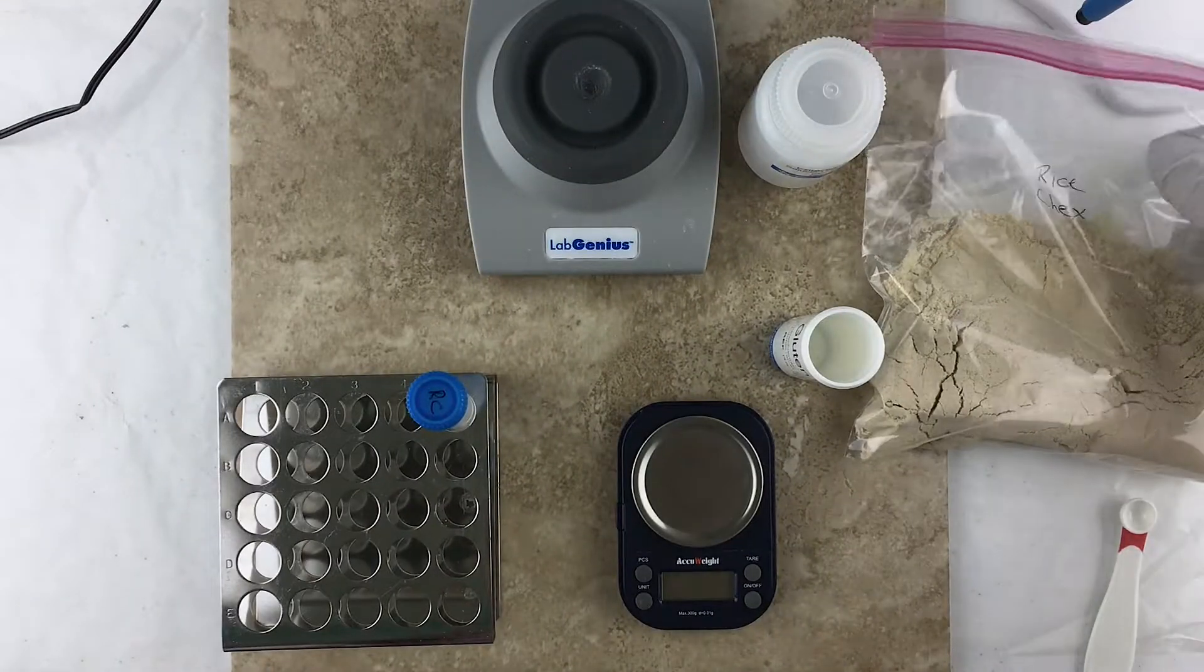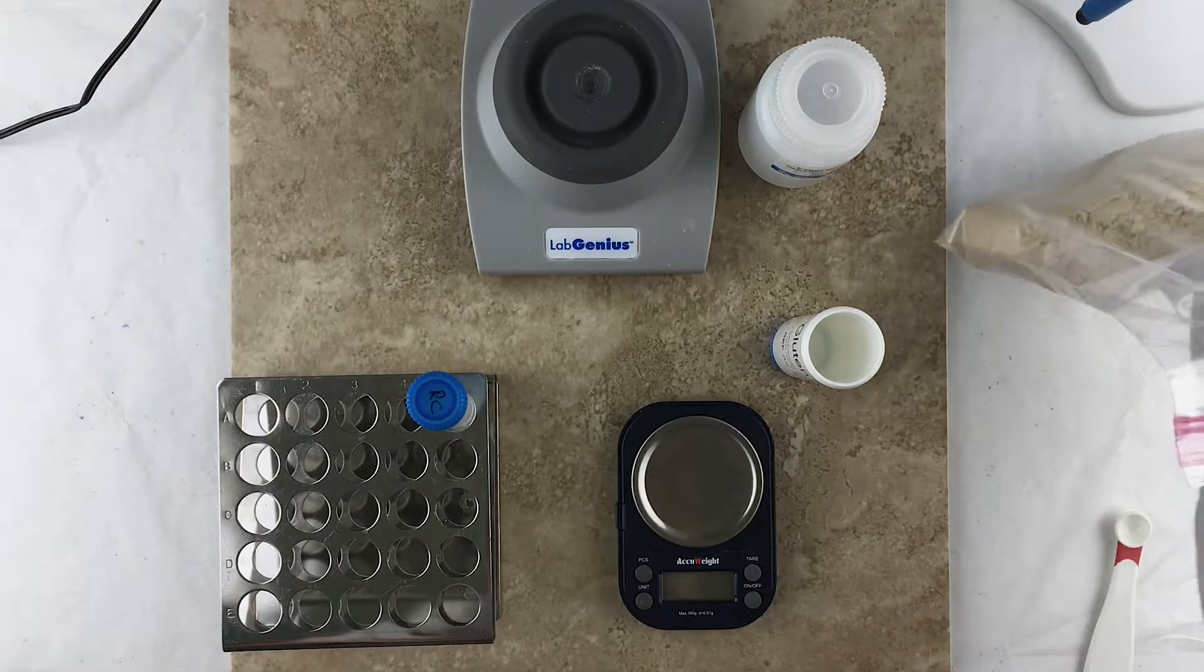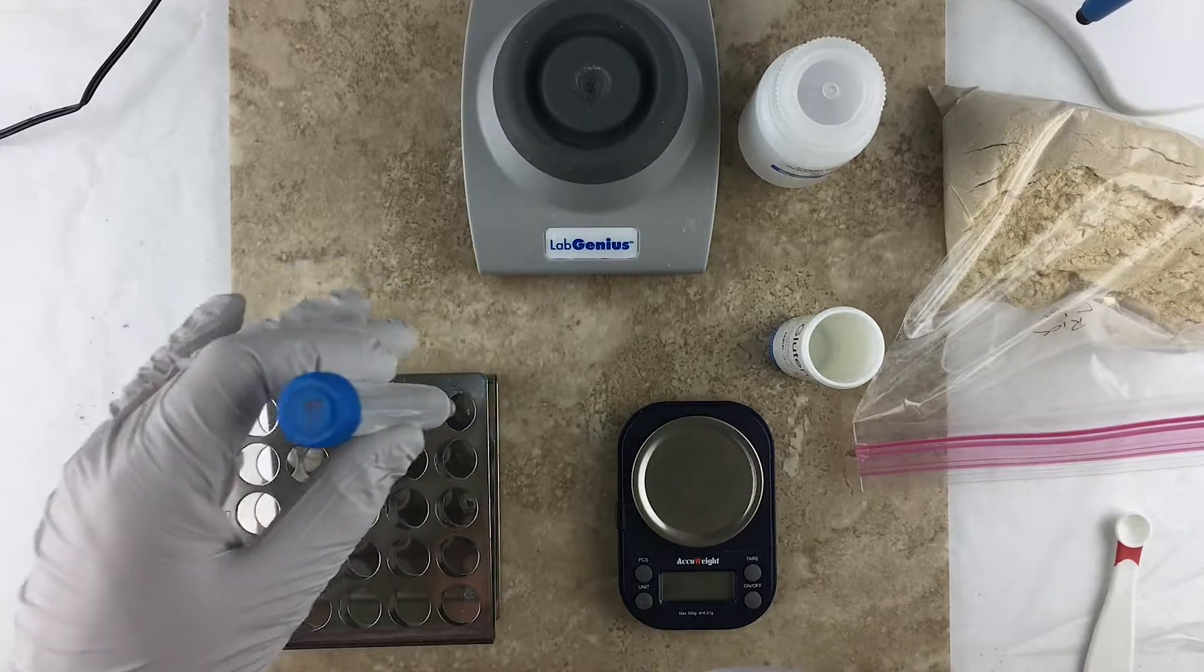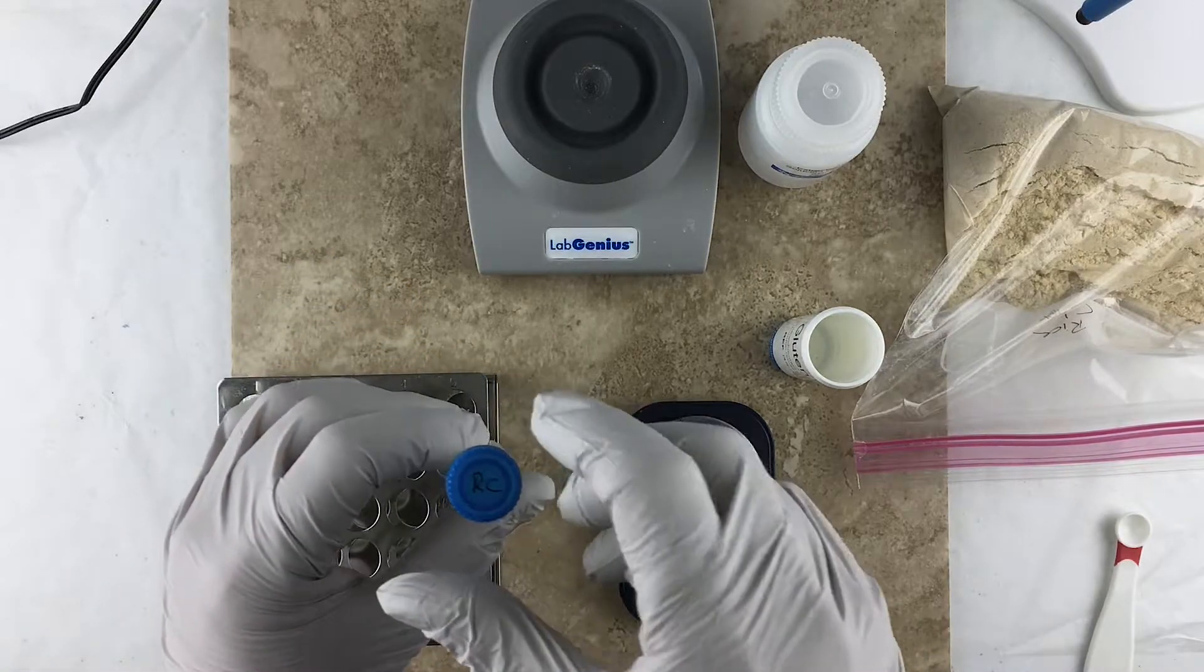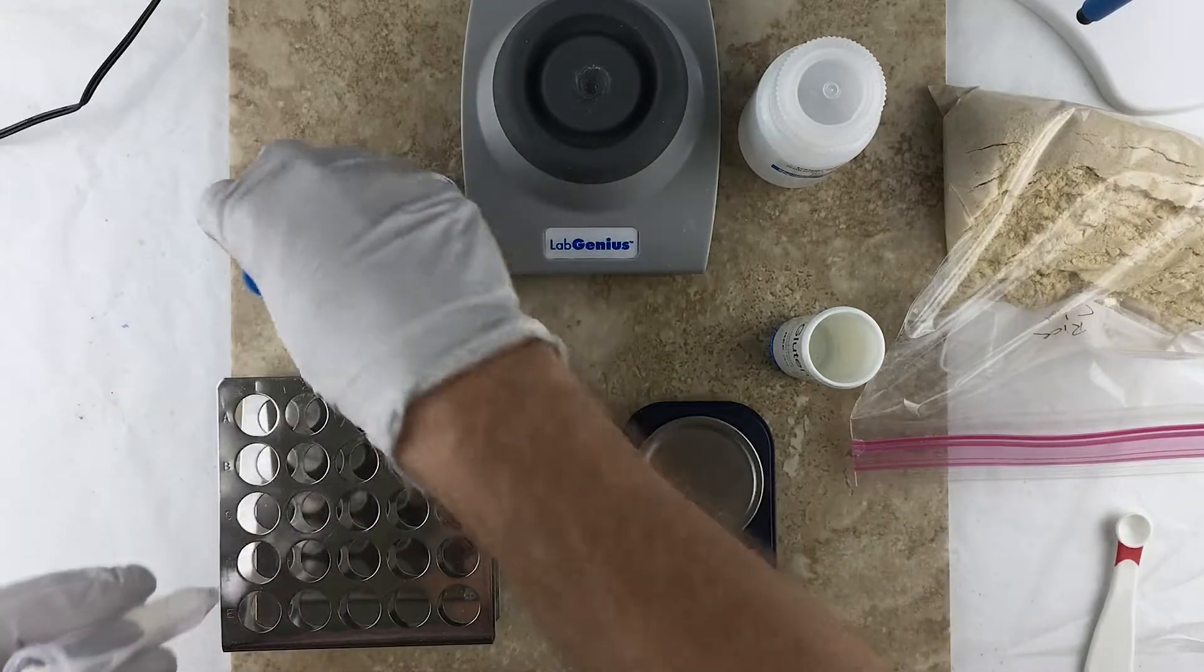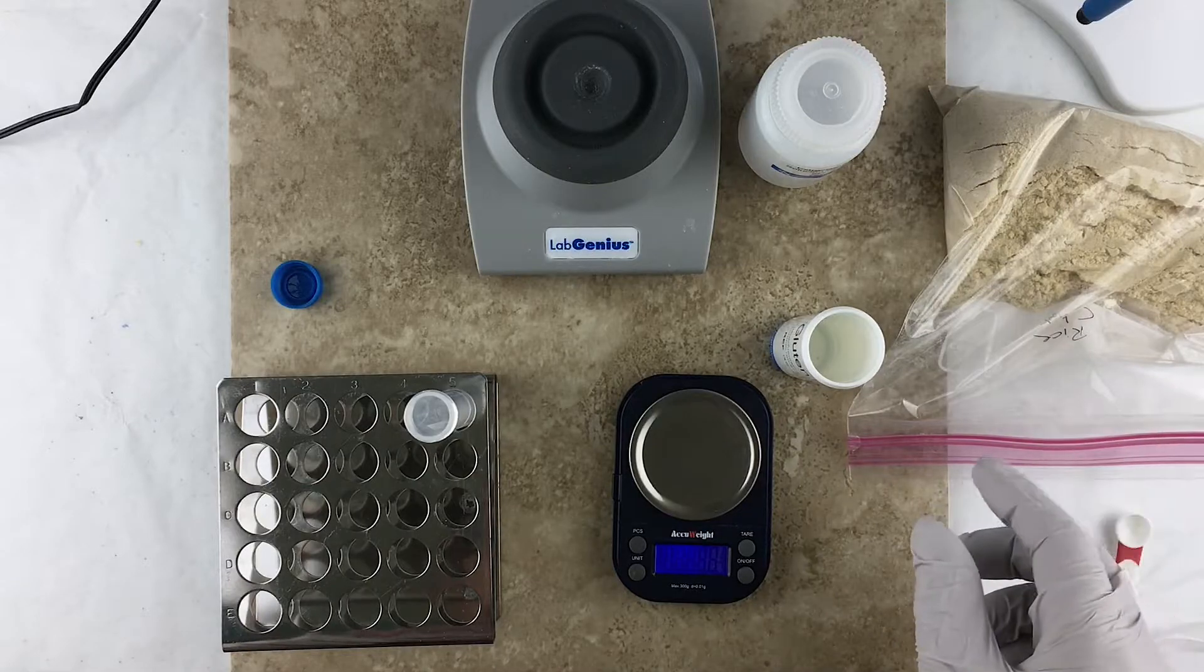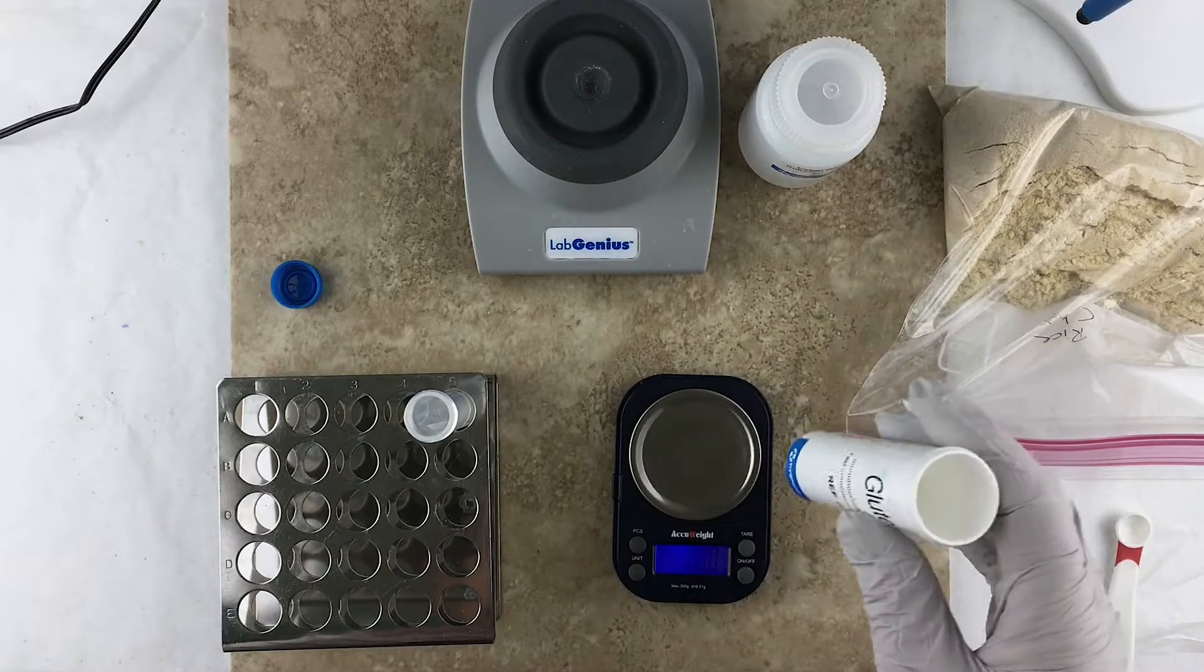All right, we've got the sample of Rice Chex here and the next step is to go ahead and measure it out. So I've got this test tube here labeled RC for Rice Chex. I'm going to take the cap off of that. I've got a scale, we're going to measure out one gram of the Rice Chex into this test tube.